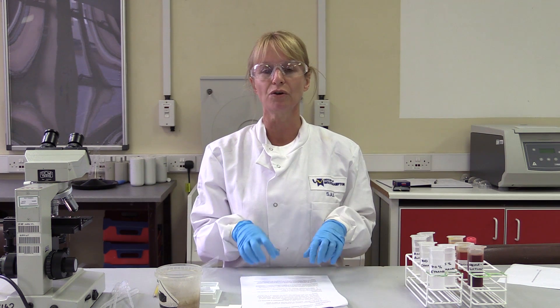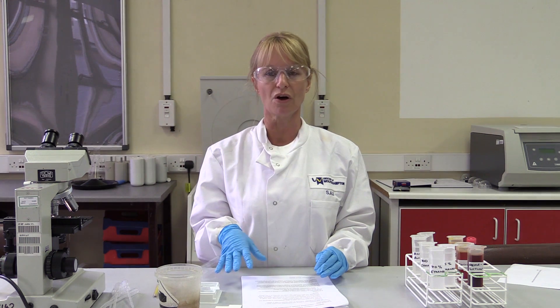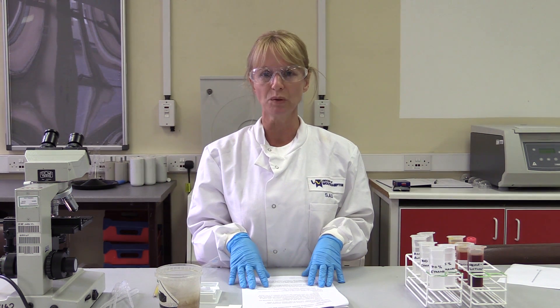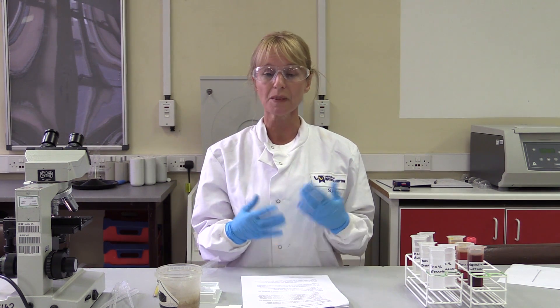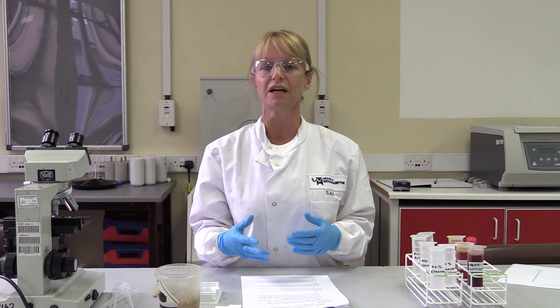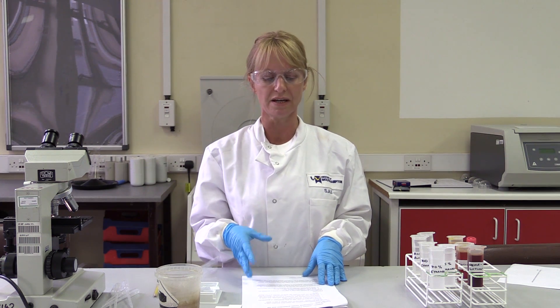Before you come to the practical session, make sure you have your personal protective equipment and that you're wearing it, otherwise you won't be allowed into the laboratory. You need to bring your lab coat, your protective goggles, and make sure you wear gloves during the whole session. You're going to be using human samples which have been fixed in alcohol, but you should always treat pathological samples as a potential danger. Don't bring personal items like phones into the lab, and always wash your hands when you leave.